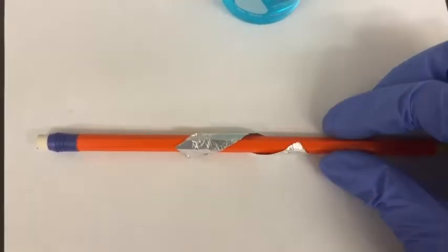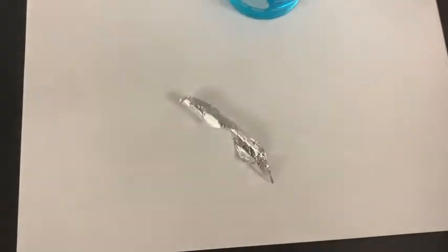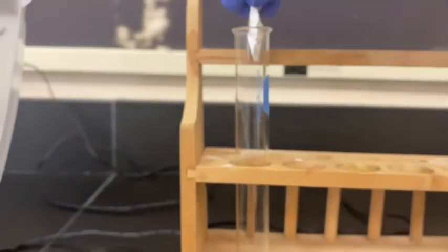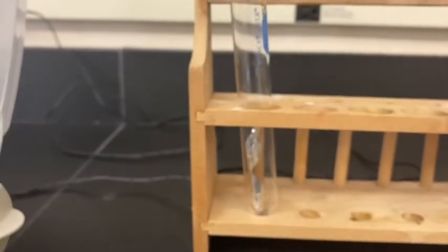I wrapped my aluminum foil around a pencil to get a nice little coil shape. I'm sure you guys are familiar with this — you have seen it at home, so you can describe some properties of it. Adding it to my test tube.